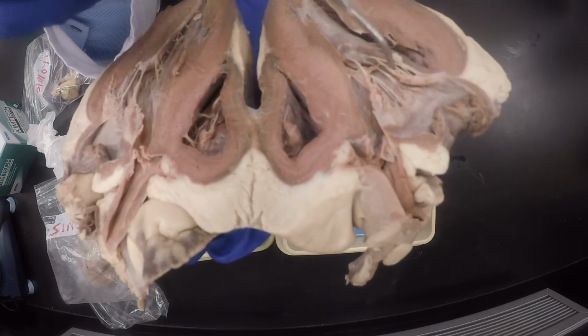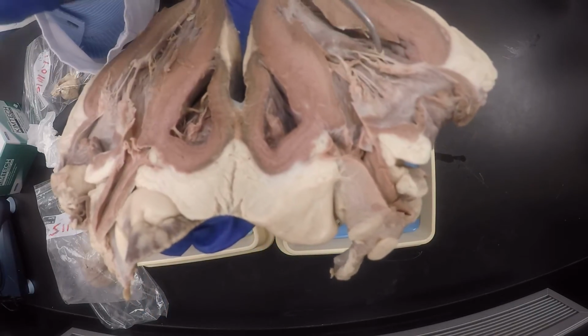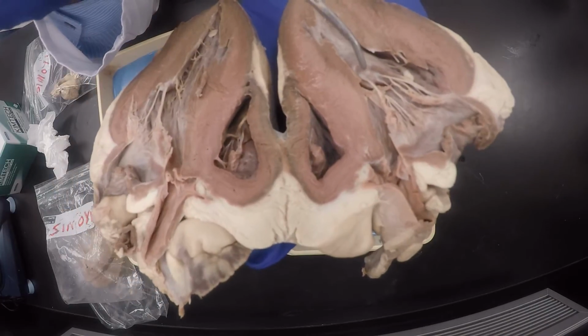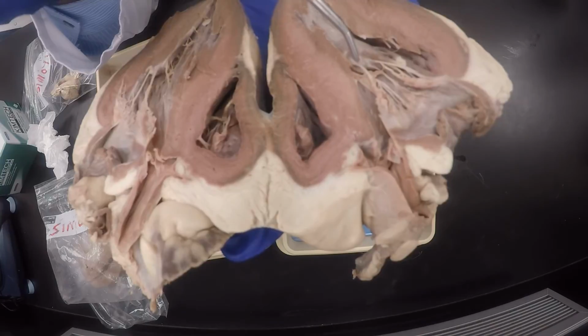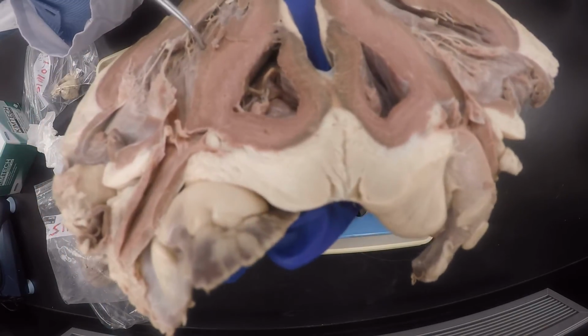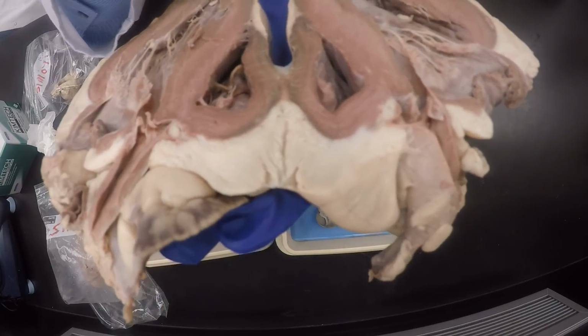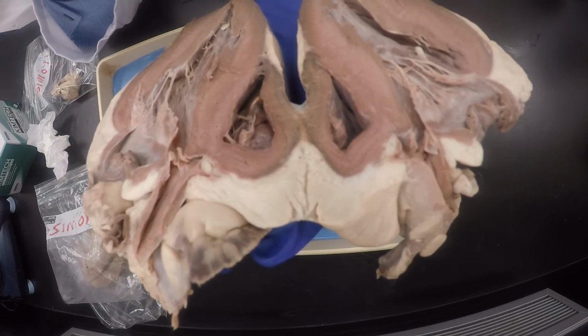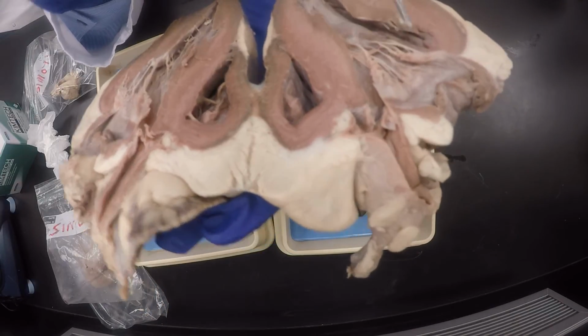And if I put a pin on these that are connected to the cusps, and I'm talking about what's that string-like structure, you'll be saying chordae tendineae. Okay, if I say what are those muscular ridges, like these ones right here, see these ones in the ventricle, you say trabeculae carneae. They're much bigger. Okay, flesh, trabeculae carneae.